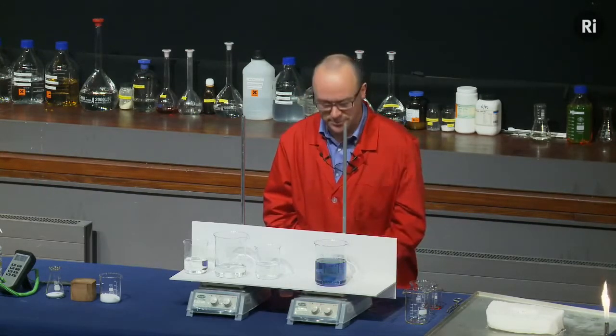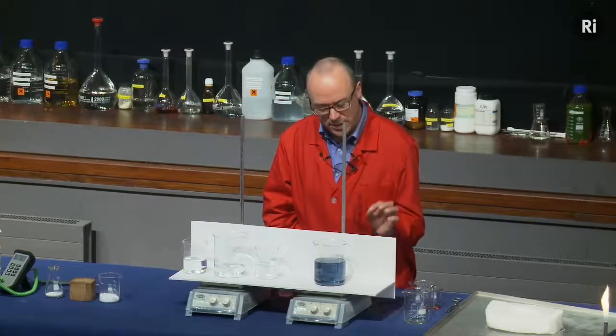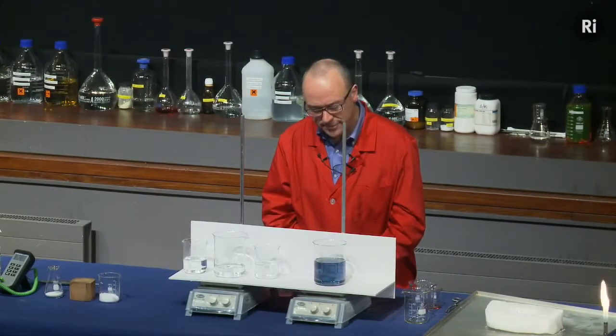That's turned back to blue. That's turned green. All right. So remember that sequence. We were green for a little while, then blue, then it went red, then back to blue briefly, now it's green.